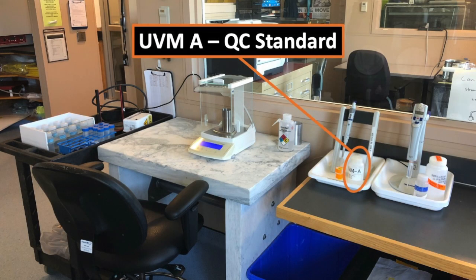We have a quality control standard that we add to each batch. We run it as a sample in each batch. And that's a way to check that the accelerator mass spectrometer is giving us the results that we would expect and to check if we have any contamination.